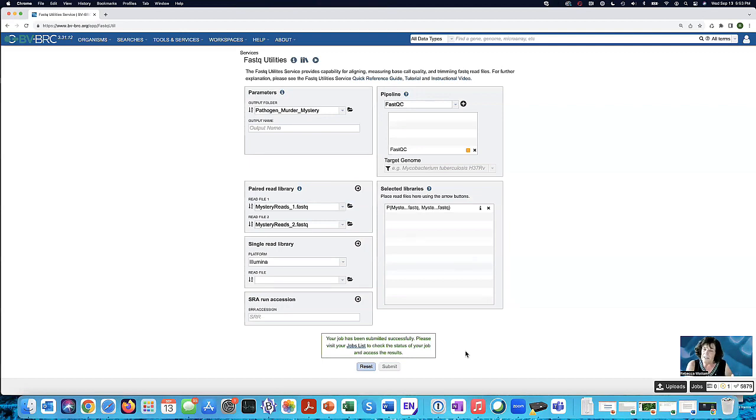Now, when I do this, or when anybody does it, you enter a queue with a lot of other people out there submitting jobs. And so it's on a fairness schedule and a first come, first served basis, unless you're a big pig and you've entered a lot of jobs all at once. Often the command line people do this. We biologists don't do this kind of stuff, but the command line people will go in and swamp the queue by submitting a bunch of jobs at once. And so there's a fairness queue there to make sure that this doesn't happen.